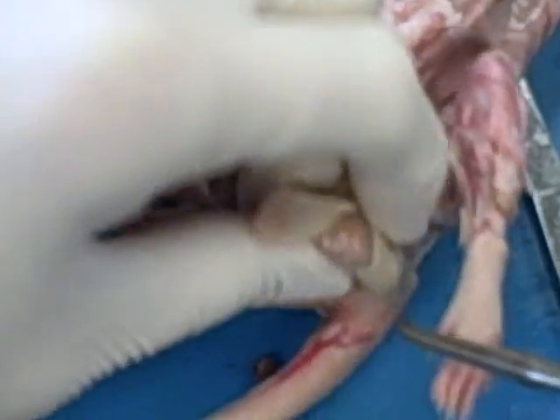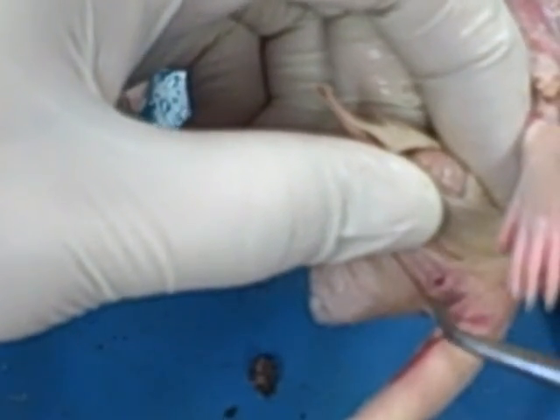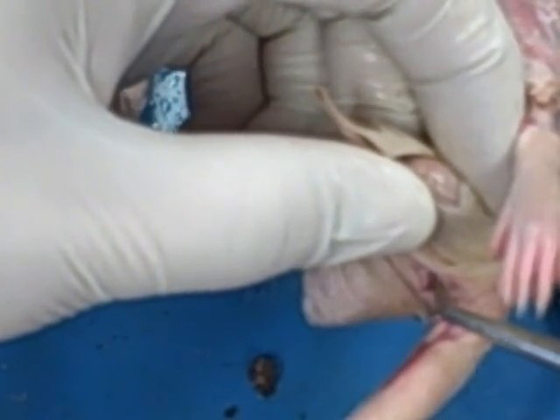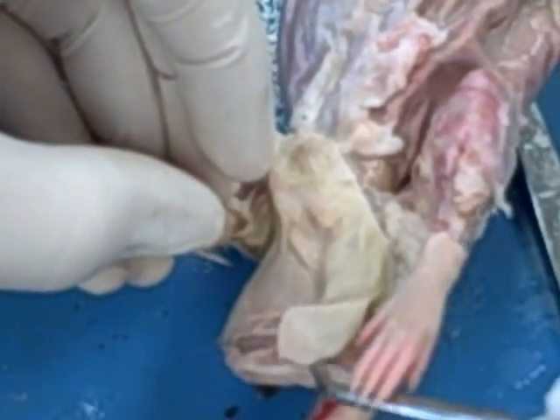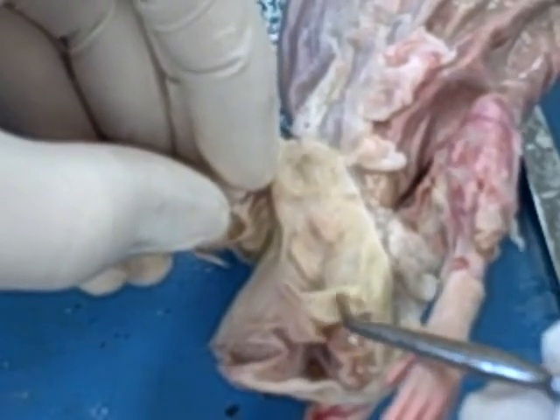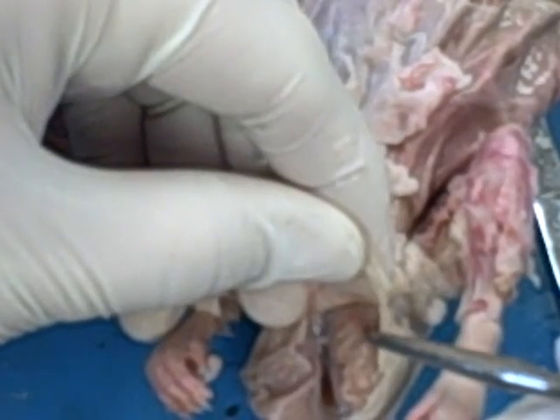So here's our male. You should note the difference between the male and female rats; it's pretty readily obvious. One thing, the anus of the male is going to be a little less obvious because the testes and scrotum extend so far. So we have the anus for a male. The scrotum, which is really just the sac of skin that encases, here we have it, removing the testes on the inside. So scrotum, testes.